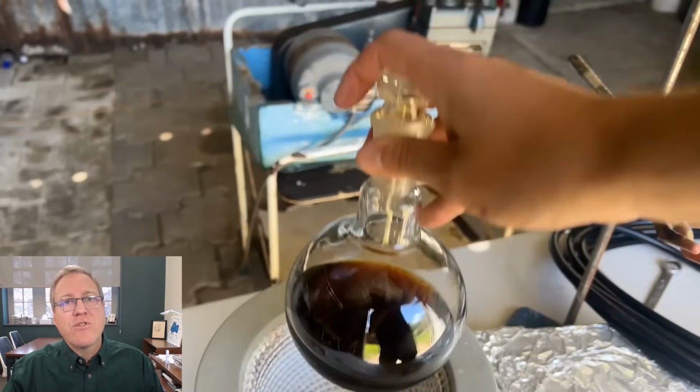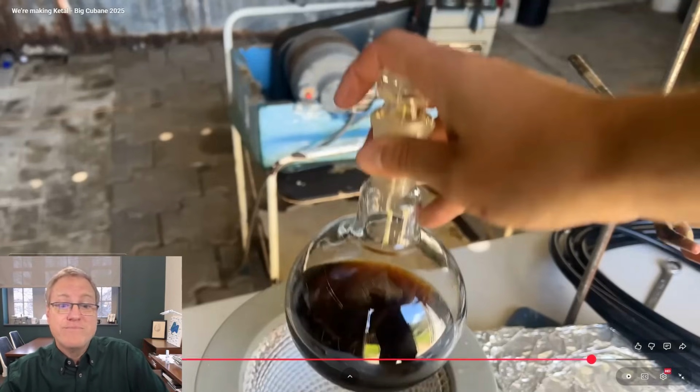Now, he's doing a vacuum distillation. Why do you do a vacuum distillation? Well, he wants to distill his product, but his product has a high enough molecular weight that to boil it, it might thermally destroy his product. So by reducing the pressure over the reaction, his product will boil at a lower temperature, maybe at a temperature at which it will not be destroyed by the heat. So by lowering the pressure, pulling a vacuum over your material, you reduce boiling points and you put less thermal stress on your compounds. And he wants his compound to survive, so less thermal stress is good.